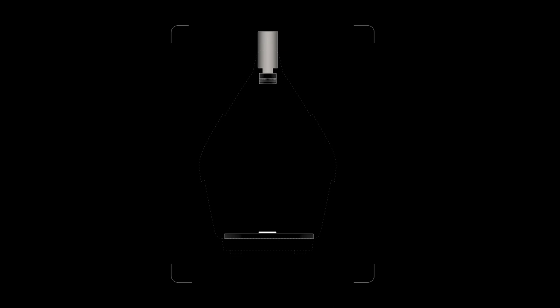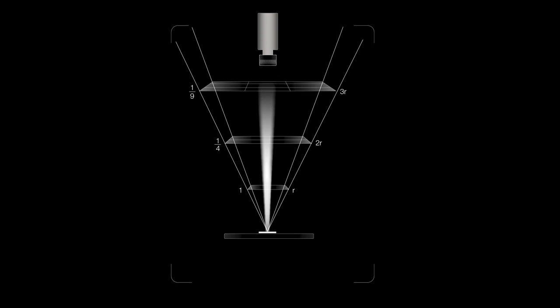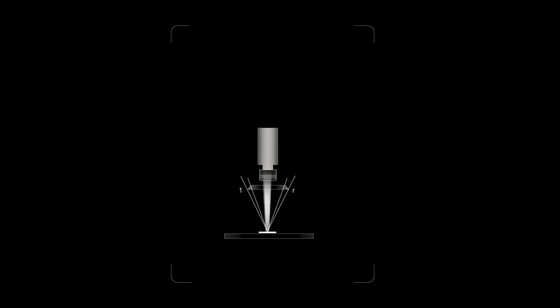We started by mocking cameras with the correct sensor and some early prototype lenses up, literally on a stick. And we moved them up and down and focused them to make sure that the lens did its thing. We looked at the sensitivity. When you move the camera in and decrease the field of view, you're basically taking the entire image sensor and using it on a much smaller area. It is essentially the inverse square law.